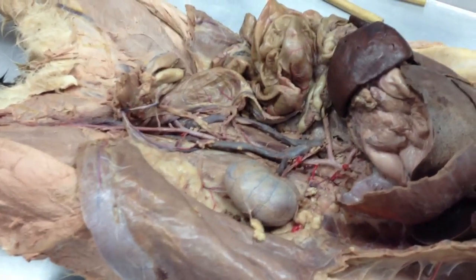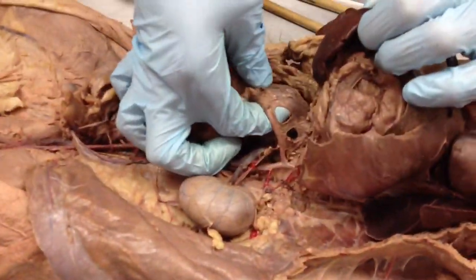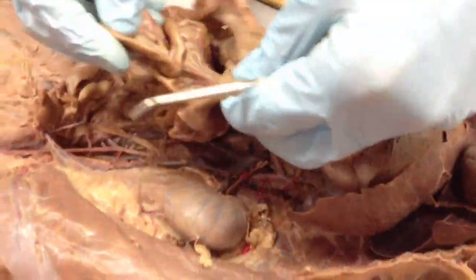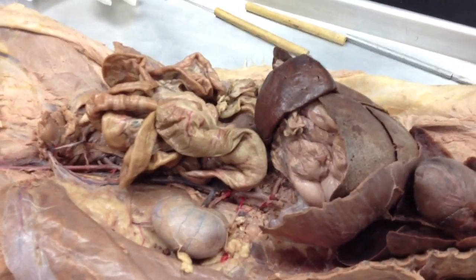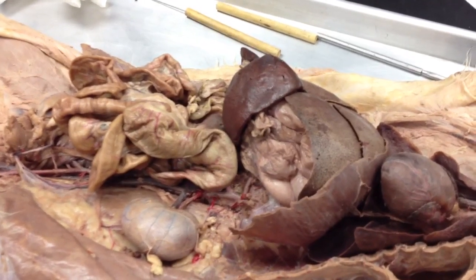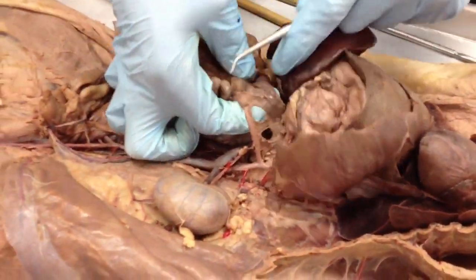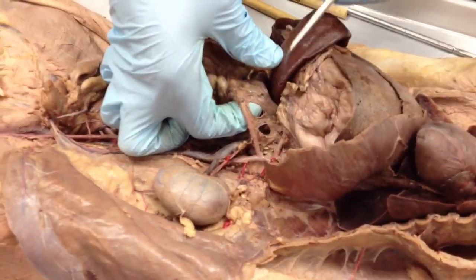The hepatic portal vein is that guy right there. You can barely see it, but it's that right there. What's going on is you have all this blood from the small intestines and large intestines that has all these nutrients and everything in it, and it's running back into the liver to be processed and cleaned, or whatever else the liver does to it. So that's probably going to be the hardest one to identify out of all of them. If you see a large, very unvein-like looking object coming from the small intestines, hepatic portal vein.